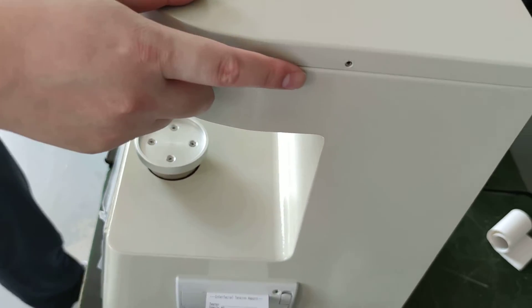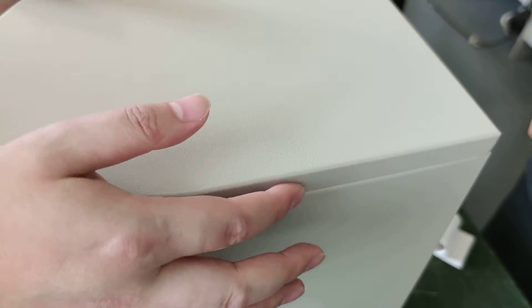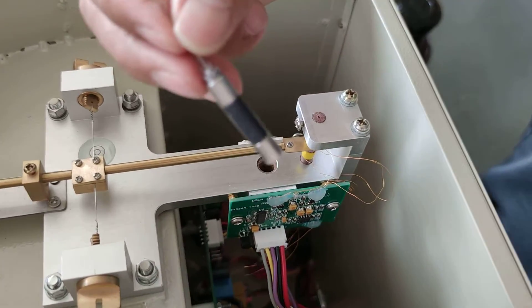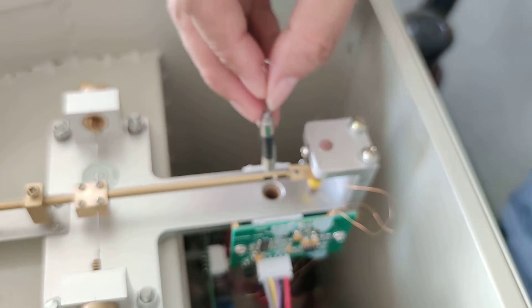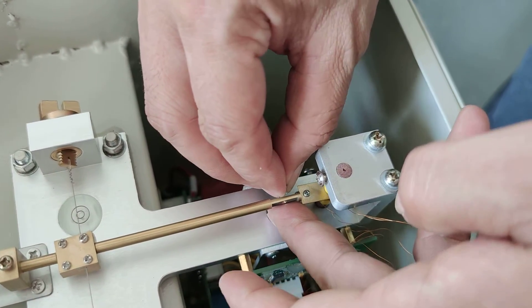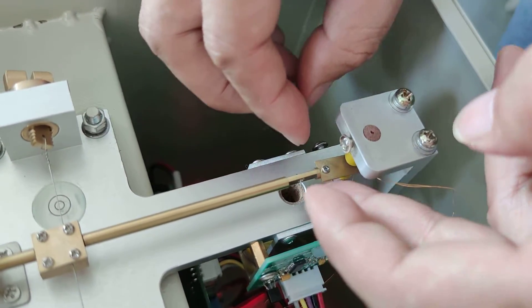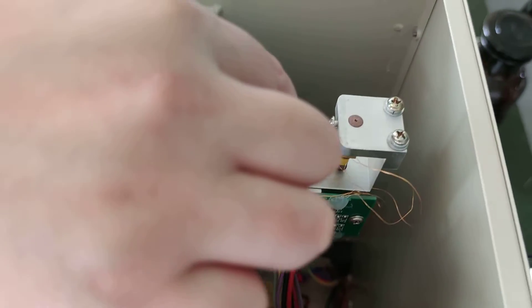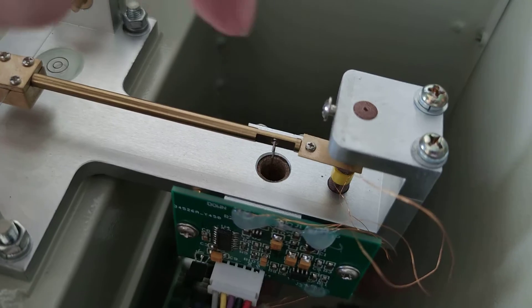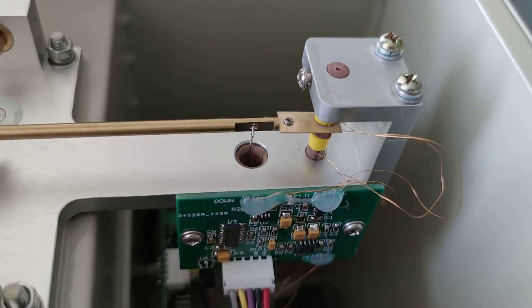When you receive the oil interfacial tension tester, first you need to remove the screws and remove the cover. Just hang the pendant in the rear part and in the front part. Make sure it's not touching the surrounding, or it may cause the testing to fail.